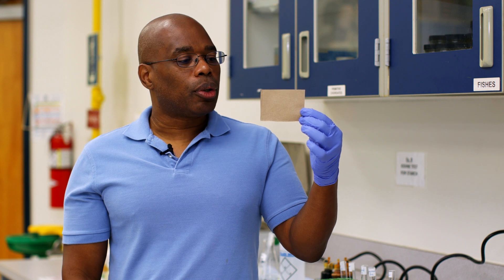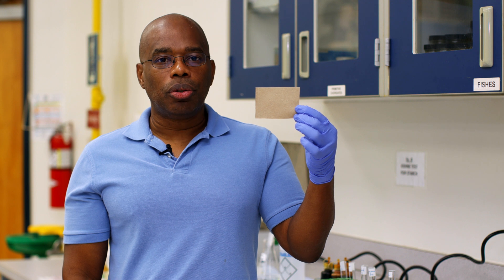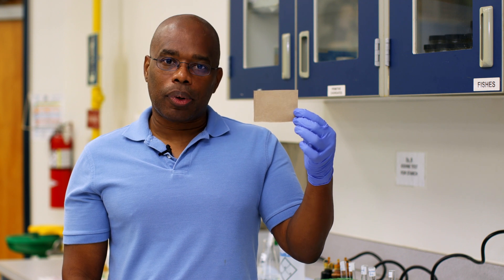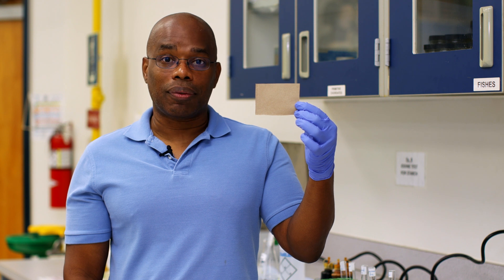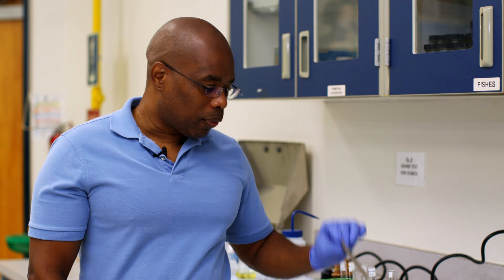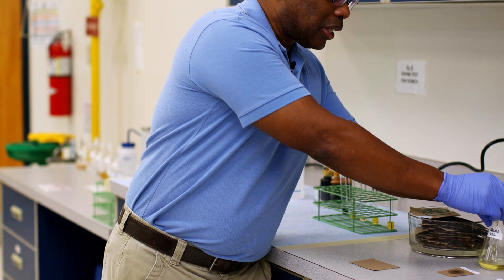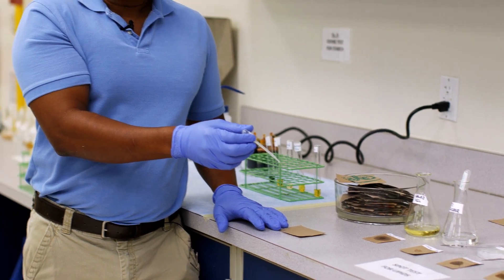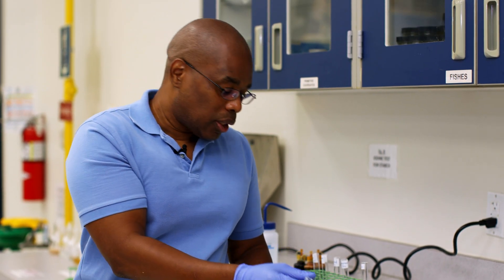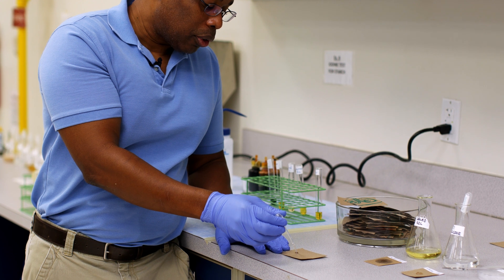The reason why we call it the Spot Test is we're going to add our solutions onto this paper and see whether they are absorbed or not. Let's do an example. First we have salad oil, and being salad oil, we know that this definitely is going to have fat and oil in it. So I'm going to add a couple of drops of salad oil to my paper.